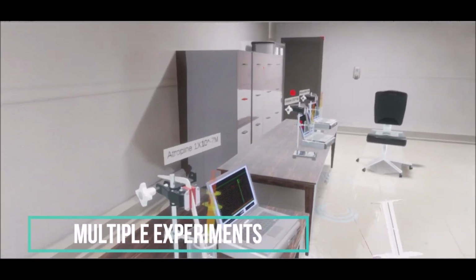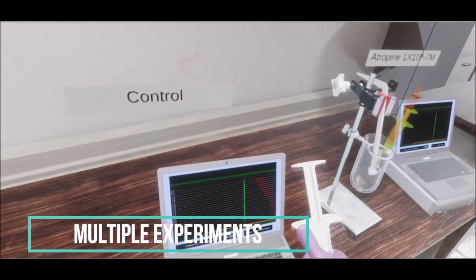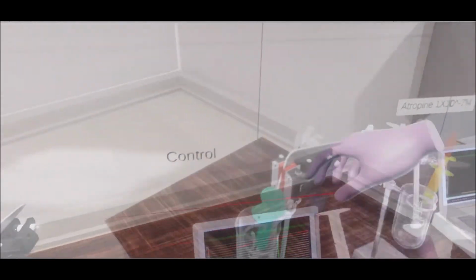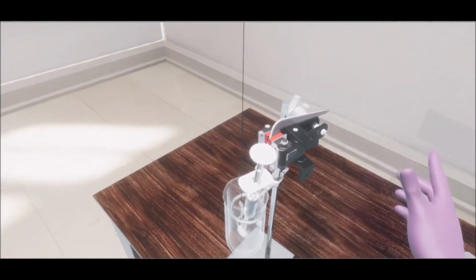The second part is the organ bath experiment station, where students will record the simulated data of biological response induced by the drugs in the airway tissues.